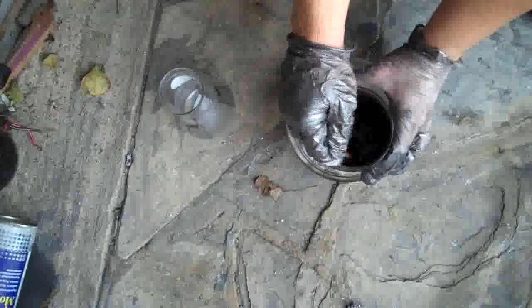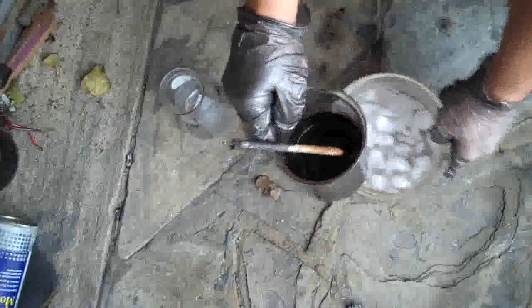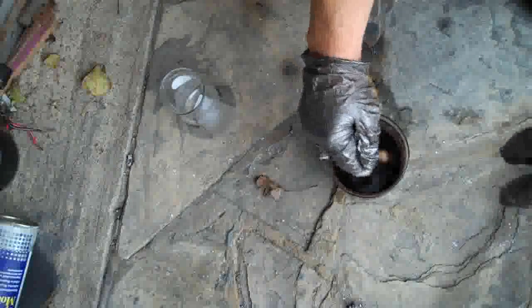I added that a bit quickly for the demonstration. If you add it a little bit more slowly and make it a little bit more cool, then obviously it won't have that little bit of fuming that we just had. But that's what you're after - just that paste. There has been no appreciable amount of fuming. I say appreciable because it does go wrong, and believe you me, it's gone wrong several times for me - that fuming is just crazy, it billows out like mad. Once you've got it to a nice paste, you can see the colour - it's kind of green and kind of brown. What you do is take it out of the ice bath and continue stirring it. We've done with the ice bath - just bring it out and then stir it for half an hour. I was considering leaving the camera on for that full half hour, but that would be a bit like watching paint dry.